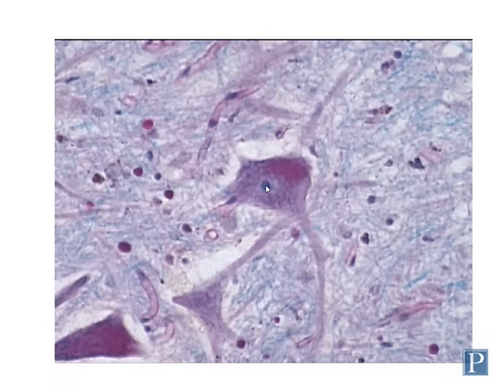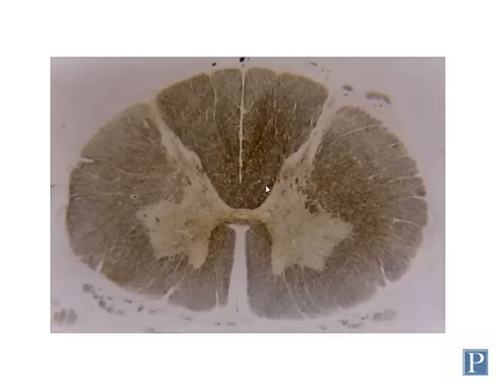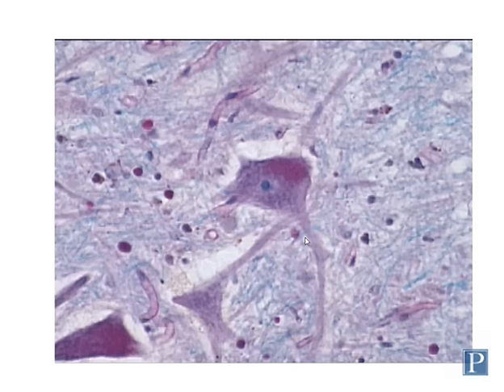So to find these multipolar neurons, you're going to need, again, to make sure you're looking at the gray matter. This time in the spinal cord, it's going to be the deep tissue, not the superficial tissue. And these particular neurons are found in the ventral horn. So you can look at the ventral horn on either side to be able to find these large multipolar neurons.